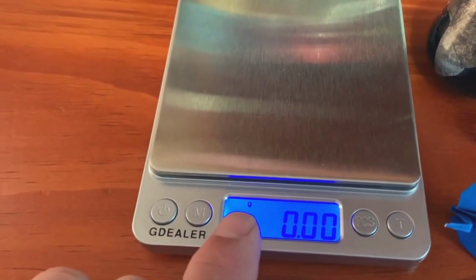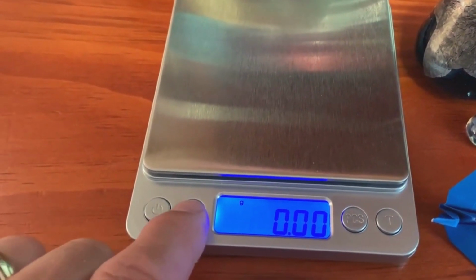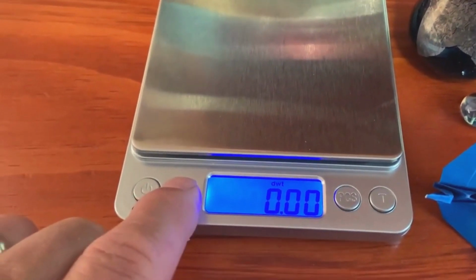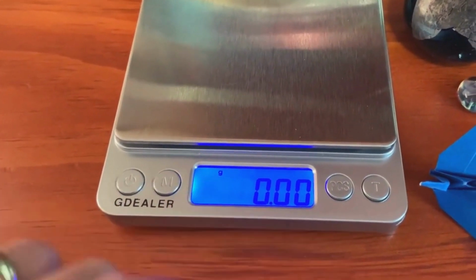Second of all, you want to look very carefully and make sure that that says G. If it says any other thing, it's because you accidentally have pushed this button. So see, we don't want ounces, we don't want OZTs. The fix is just keep pushing this button, sort of firmly and hardly, until you get it to say G.